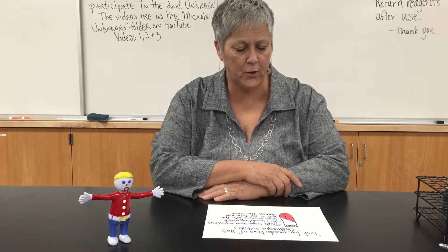Hi students, this is Professor Schimold and I'd like to talk to you about the test for hydrogen sulfide production.